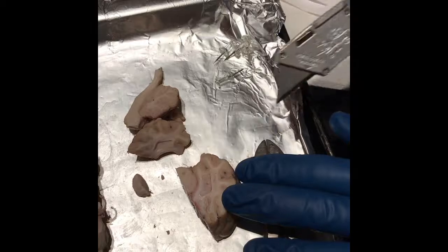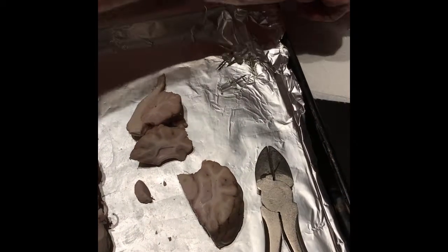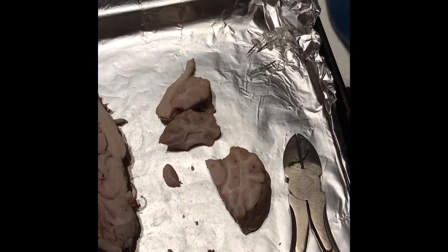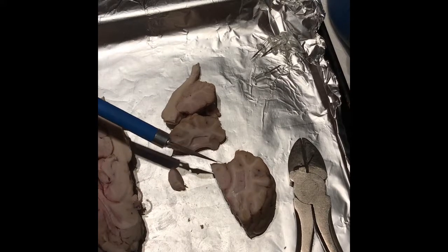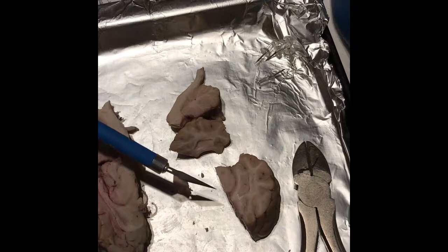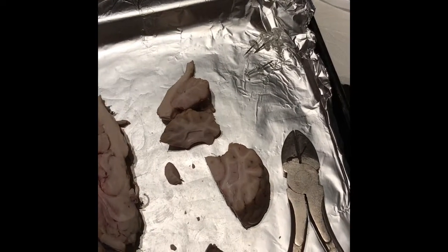Okay, and I think that relays, I got it, center in the thalamus for the visual pathway and receives major sensory input from the retinas. Yeah. We have the lateral, and the lateral's up here, and then the medial, and then the hippocampus up there. Nice. Very cool.